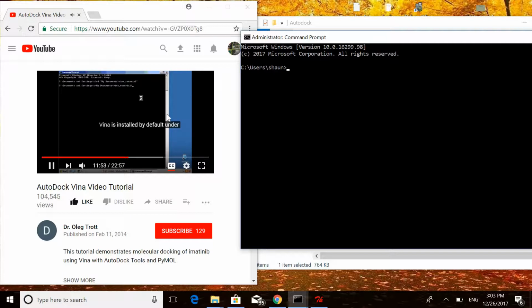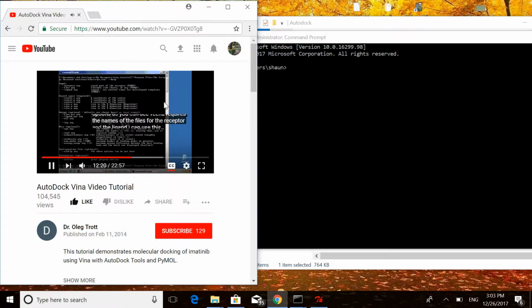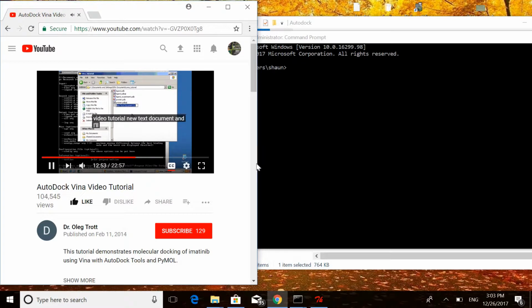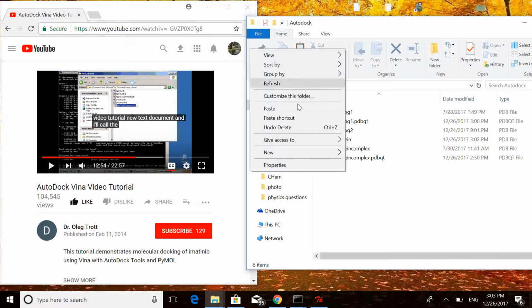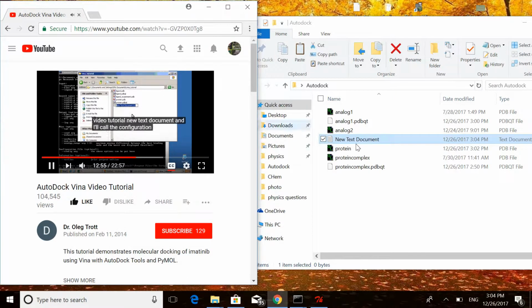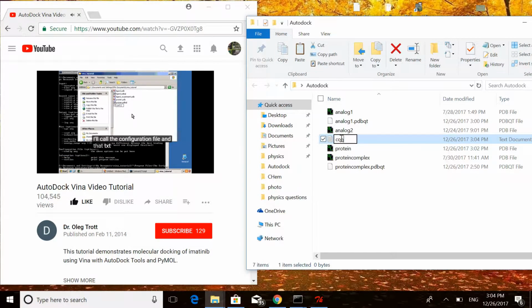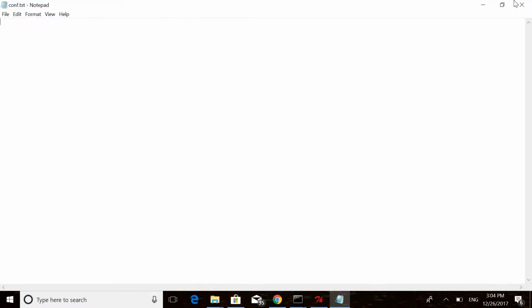Vina is installed by default under Program Files, the Scripps Research Institute. To print the other options to the file, however, sometimes it is easier to use a configuration file. Start, My Documents, New Text Document, and I'll call the configuration file conf.txt and put the options in there.